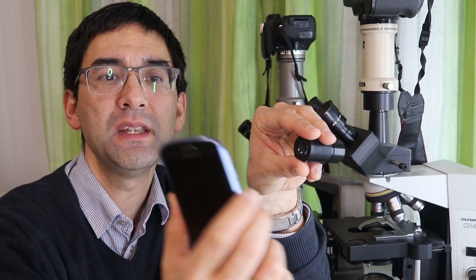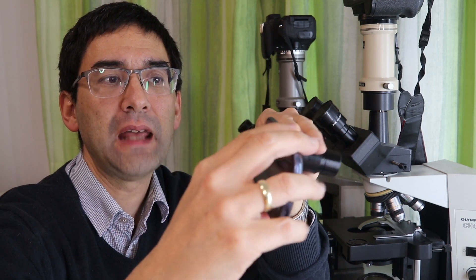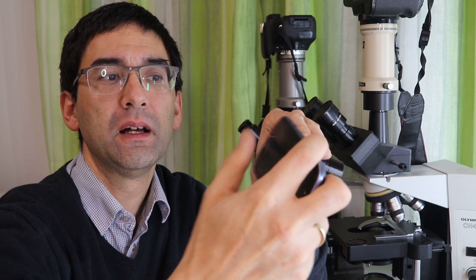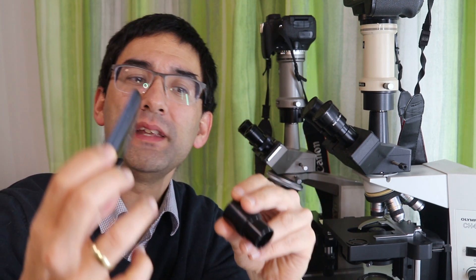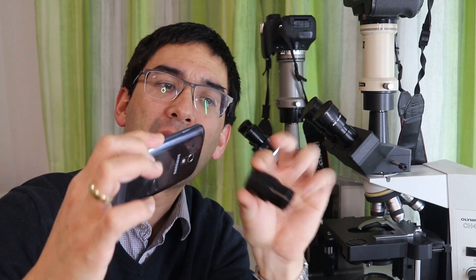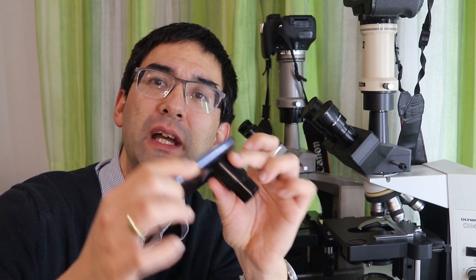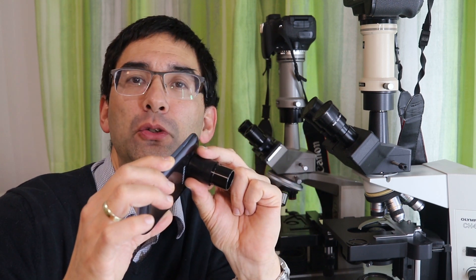So you need a lot of patience and what I would recommend actually is the following. I recommend that you place two fingers over the eyepiece like this and you see that it's a little bit higher than the eyepiece, and that you place with your other hand the camera on top here. Like this and that you try to take a picture like this. You basically need to make a rest for the camera using your fingers because you cannot place it directly on the eyepiece because that would be too close.